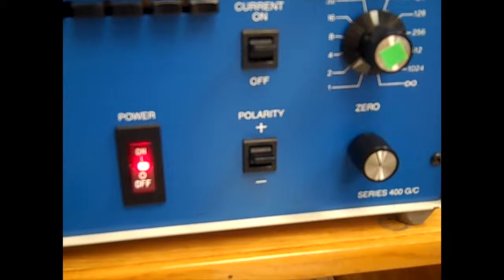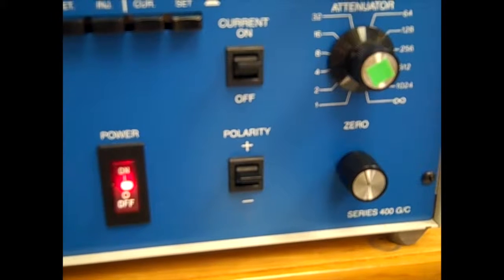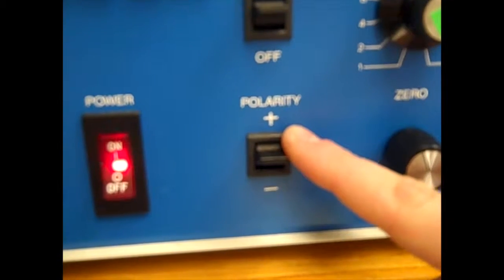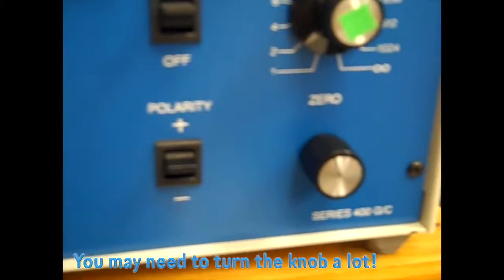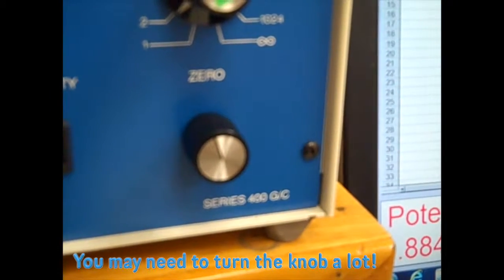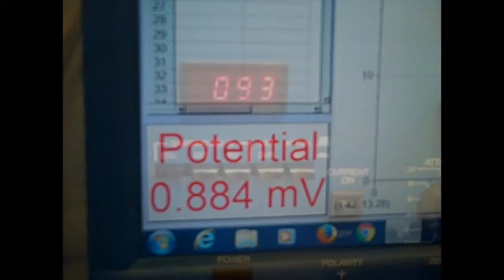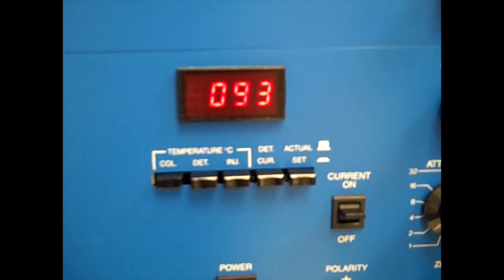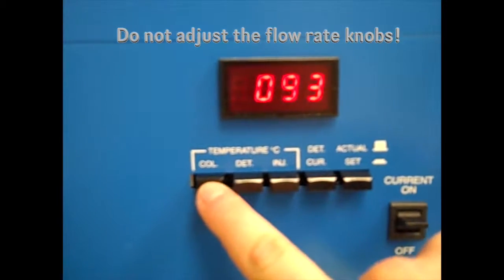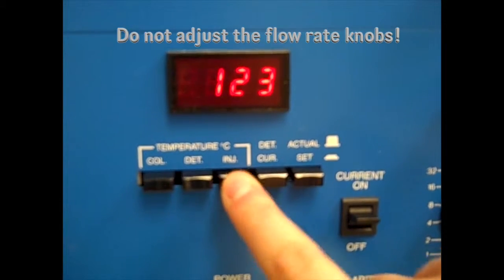Depending on what column you plan on using, set the GC polarity switch to the plus for the nonpolar or the minus for the polar column. Use the zero knob to adjust the millivolt reading on the computer screen to 0.8 to 1. On the GC instrument, record the temperatures and conductivity of the column temperature, the detector, the injector, and the current.